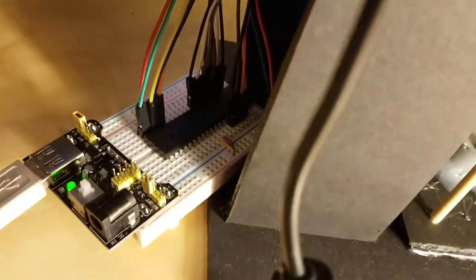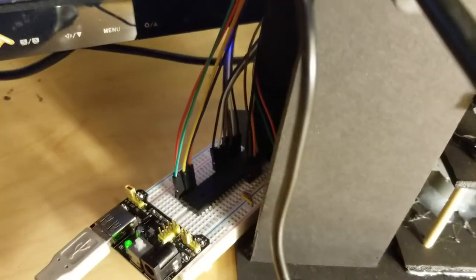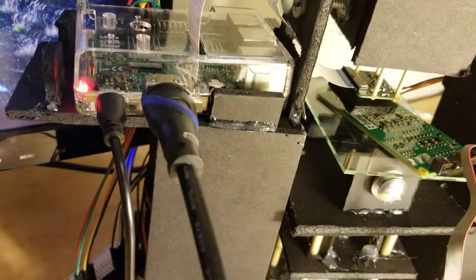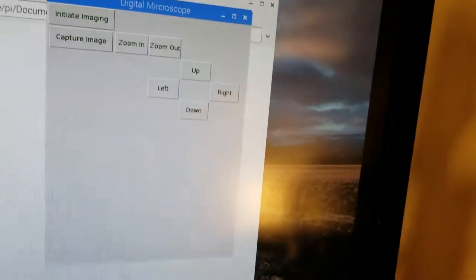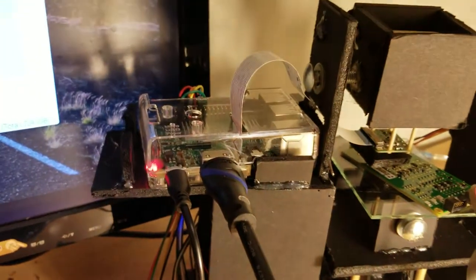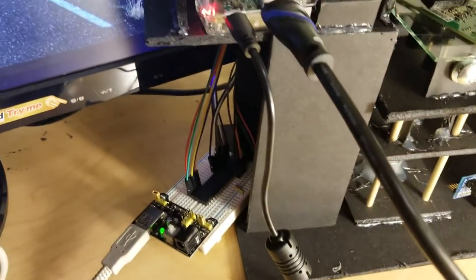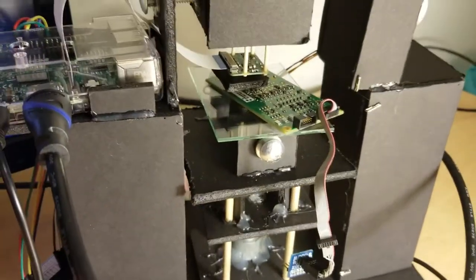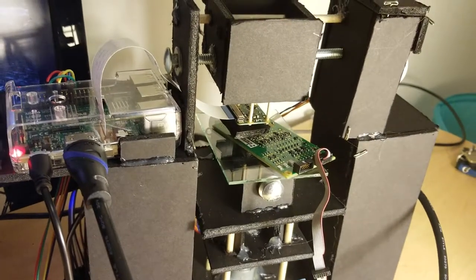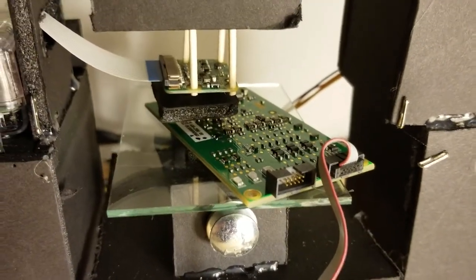We can see that it's exactly what we were looking at. Alrighty. These servos are controlled by an Atmega 1284 microcontroller, and this microcontroller is getting its information via the Raspberry Pi. As we explained earlier, the user interface is here. If I click zoom in, zoom out, up, down, left, or right, an electronic message is sent from the Raspberry via these cables into the Atmega that tells it to move the servo that controls the zoom in or zoom out, or any of the other servos, depending on the user's input.